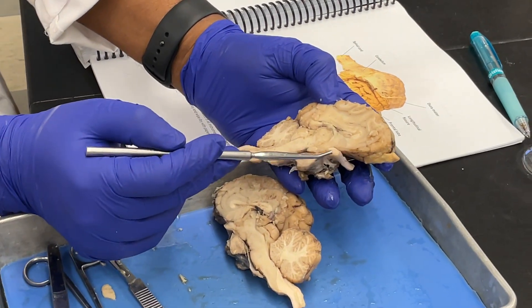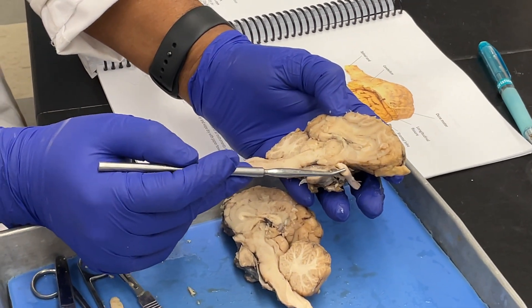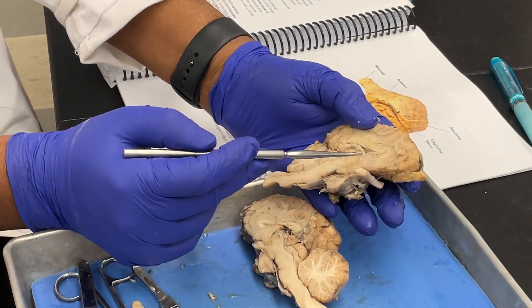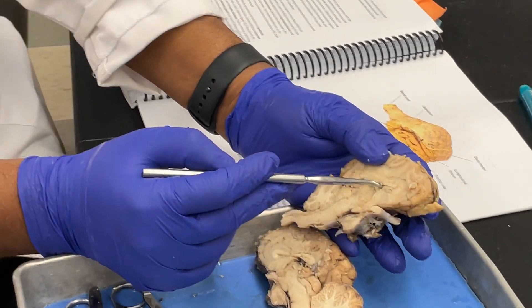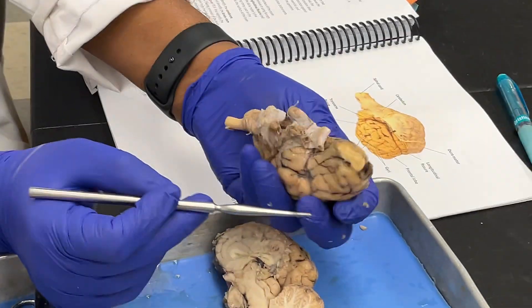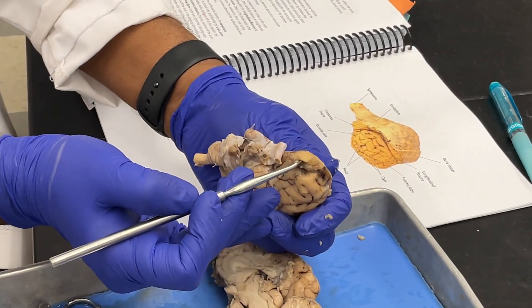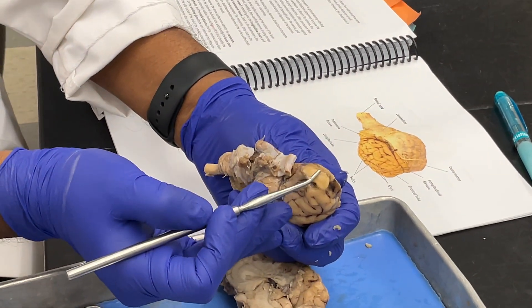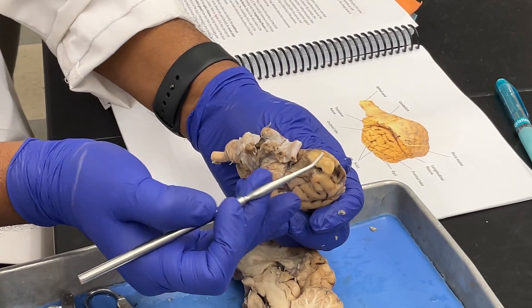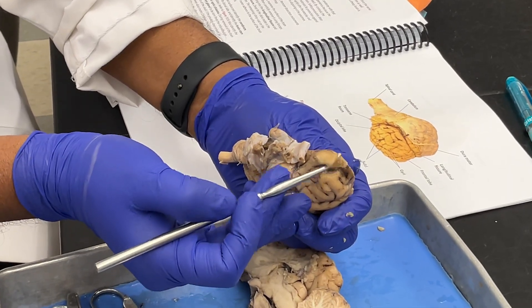Here we have the pituitary gland and the optic chiasma. The olfactory tract comes in here — this is the olfactory tract.